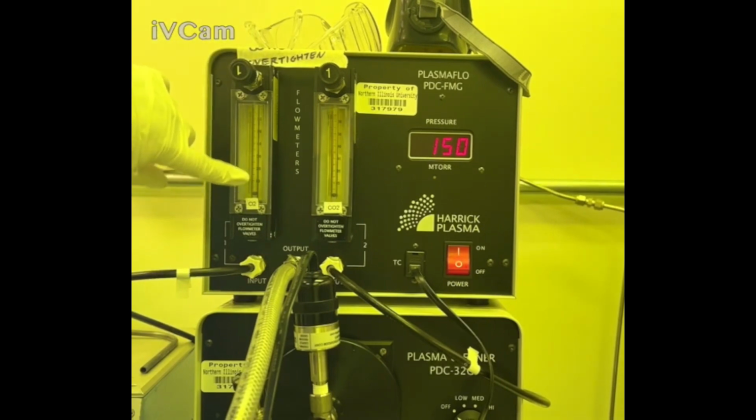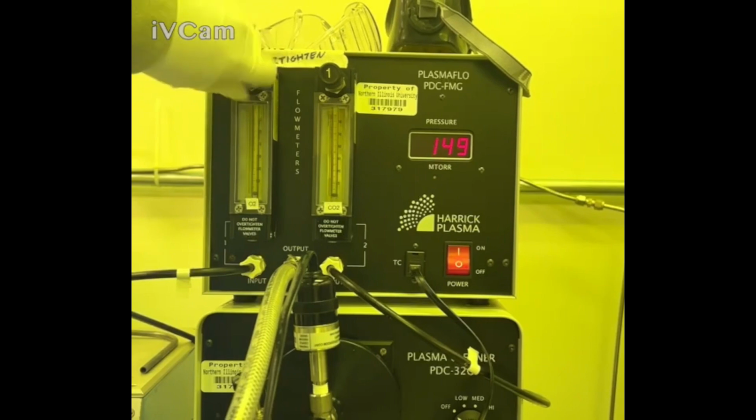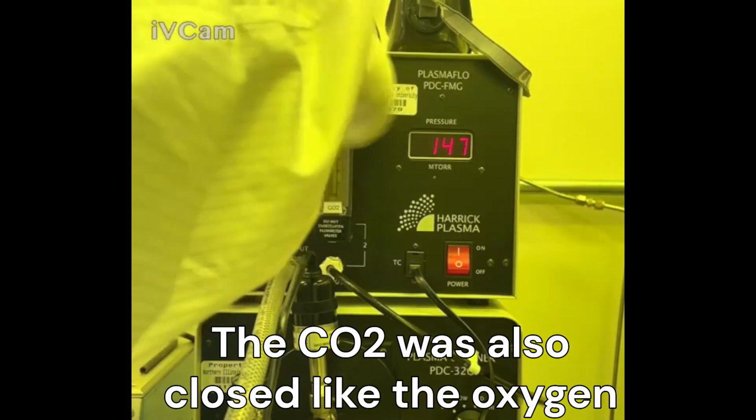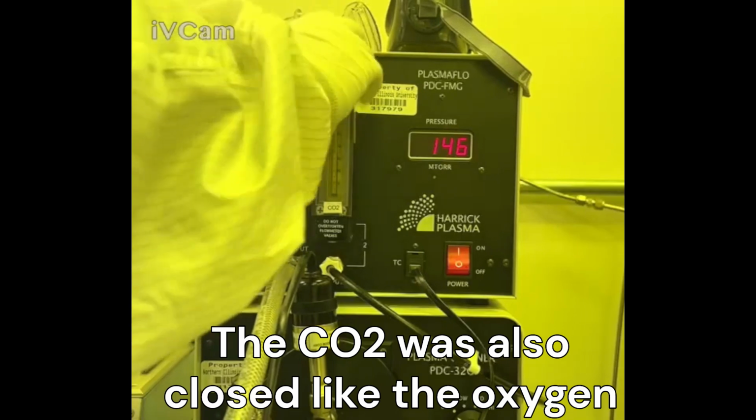So this sphere is actually supposed to go all the way to the top. It's not doing that. If for whatever reason the oxygen is not working, you can flood it with CO2 as well. It will change the surface ionization that you're working with. So I'm going to try CO2 for right now, just to show the process of it, which is not turning on.